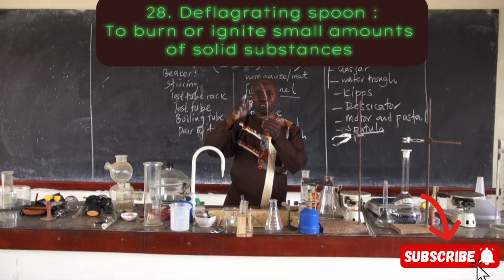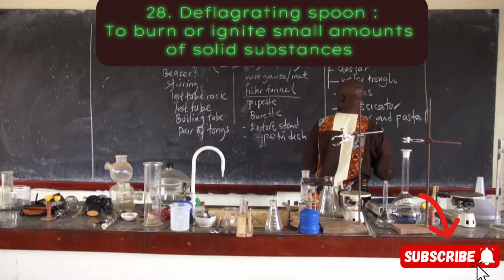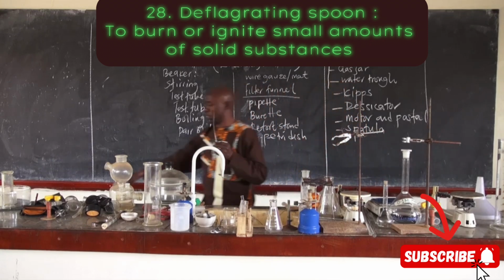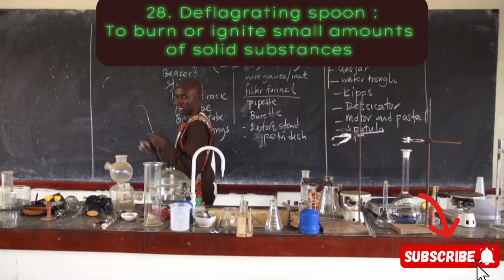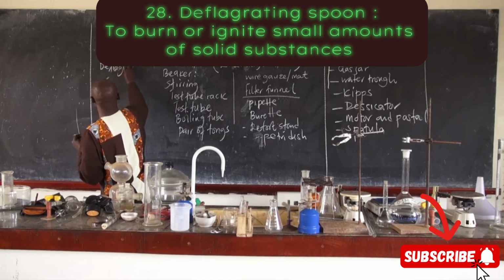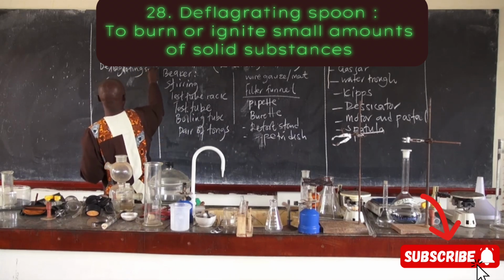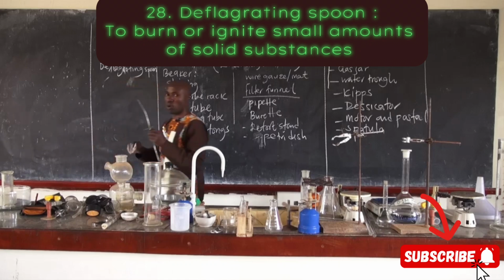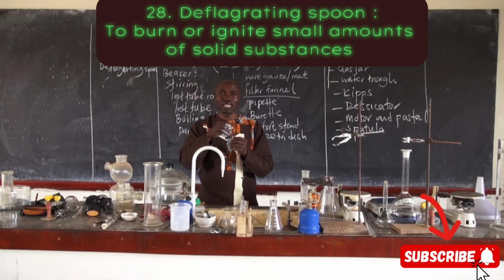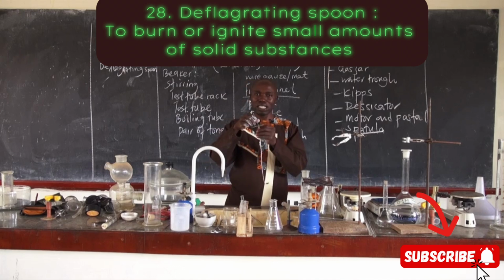This is called a deflagrating spoon. Let me clean off this. It says deflagrating spoon. A deflagrating spoon is used for burning or igniting some solid substances.